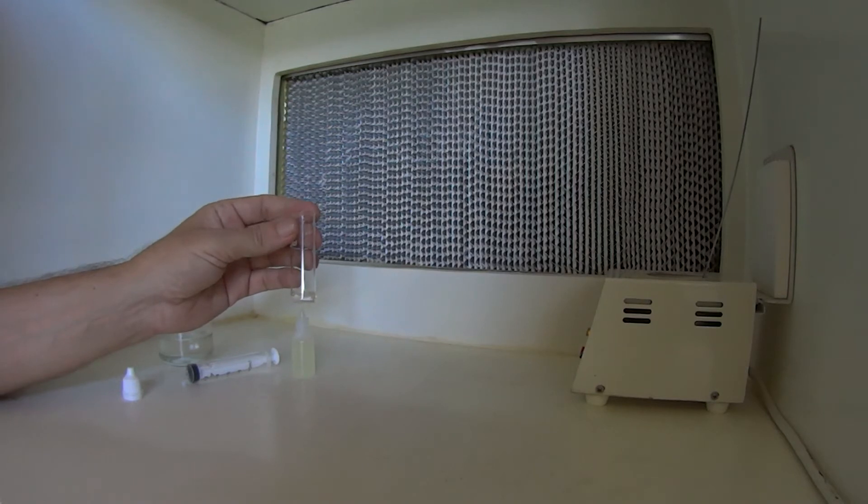But the easiest way I find is using my glass bead steriliser. Basically put the product in there, let it heat up and dissolve, and pull it out and we'll go from there.